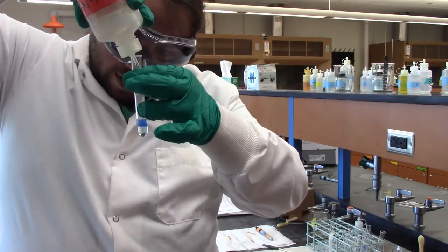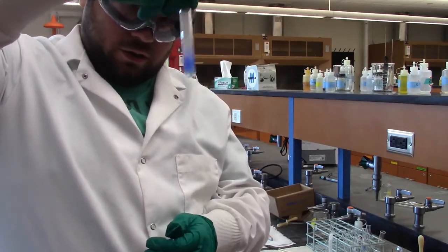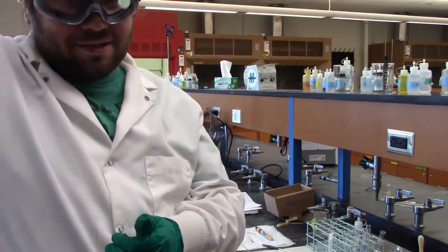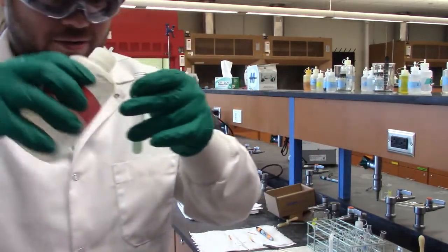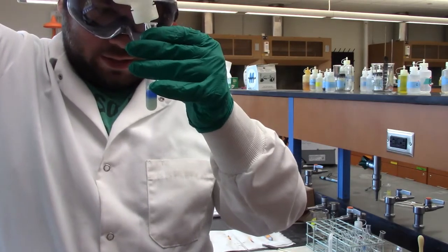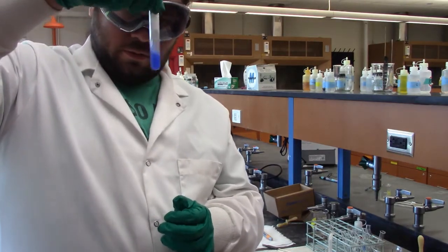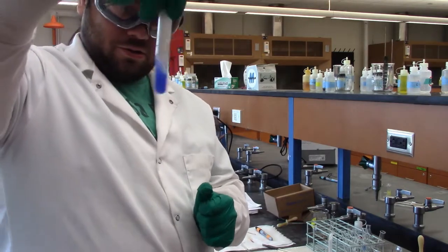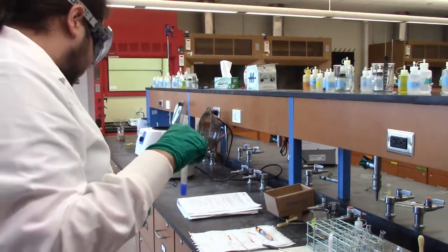And if you look at that, you'll see some nice blue coming out of there. Give it a good swirl. There comes your bismuth too. And it kind of disappeared, but like Professor French said, that's also some bismuth probably coming out. So let's add some more of this, to continue to make it basic. There you go. If you look at that, that blue color, I believe, is our confirmation of copper. Yep, it's a very pretty blue copper tetraammine complex.